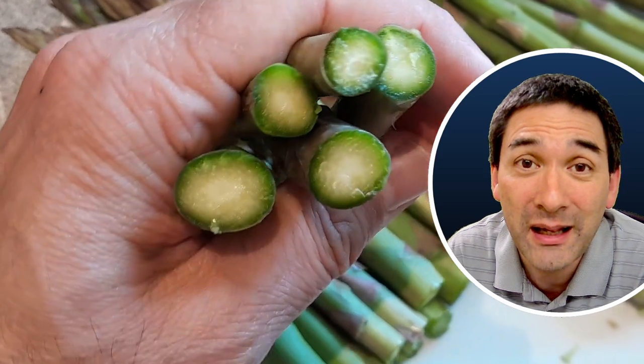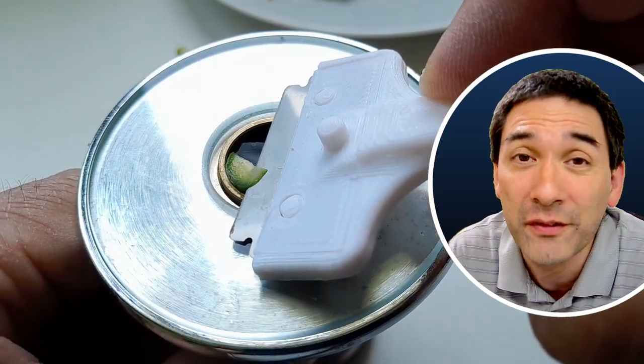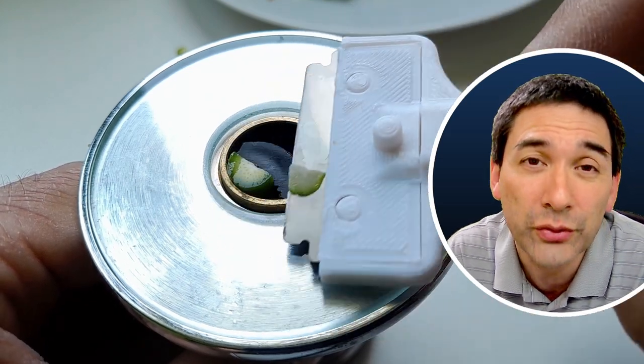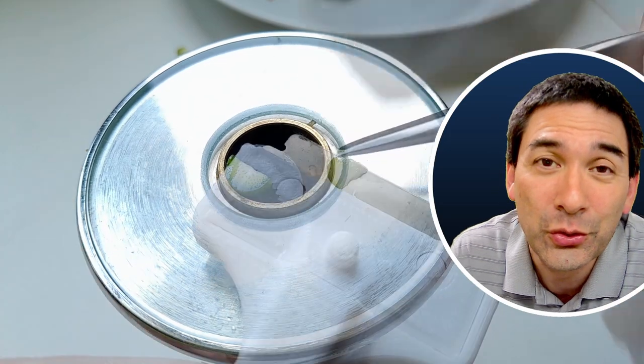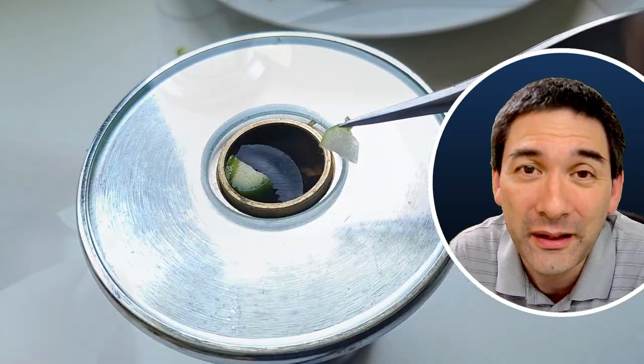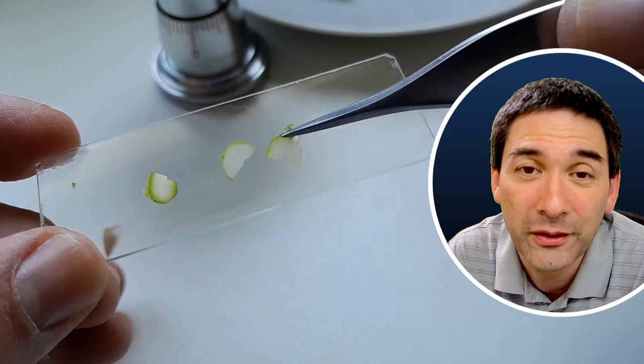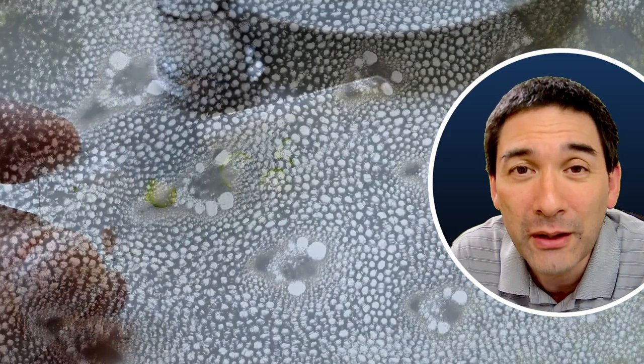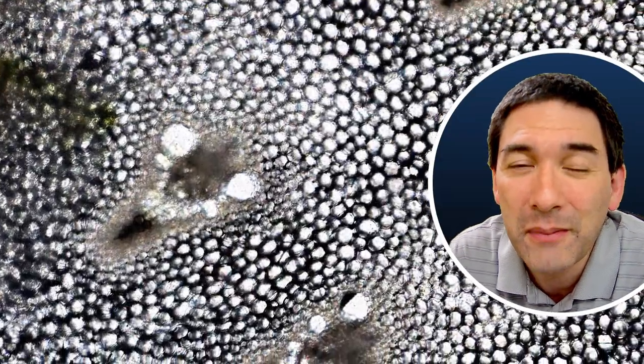Asparagus, this is, and I wanted to demonstrate to you how you can prepare the stem of an asparagus to observe under the microscope. So I used a very sharp razor blade here, and in order not to cut myself, I also 3D printed a holder for the razor blade. Everything went of course on the microscope slide, and under the microscope I was quite happy to see that the individual cells were quite clearly and cleanly visible, which actually shows that the cut that I made was quite thin.